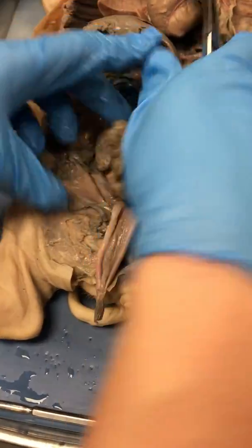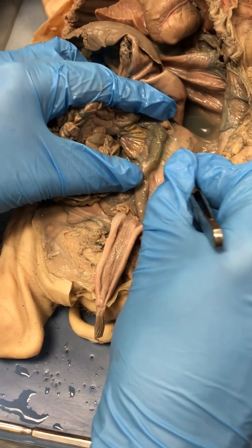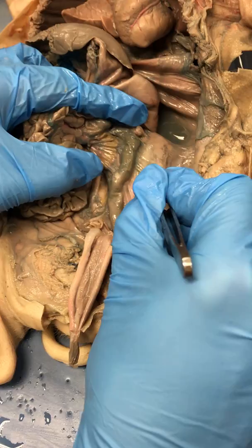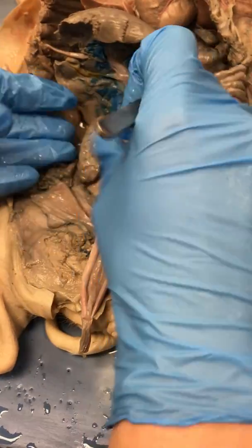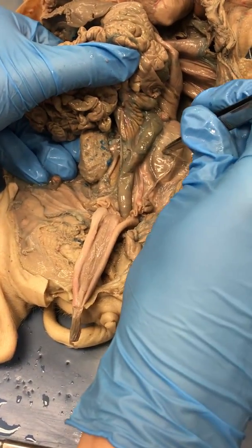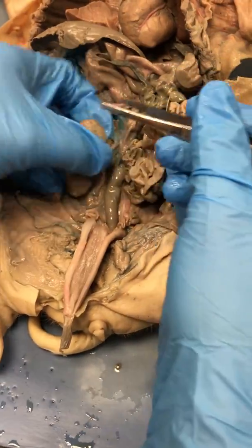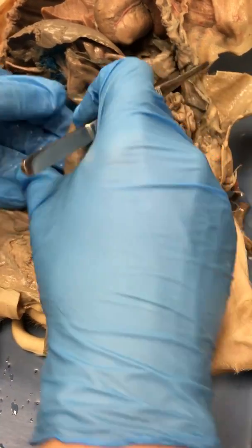to be able to see the urinary tract, you're going to have to break down this membrane right here. What is the membrane that encased the abdominal organs called? Peritoneum. Good job, guys. Okay, so you've got to break that down. Once you've broken that down, you see you've got a set of paired organs right here. These organs are what filter blood and produce urine. Those are our what, guys? Kidneys. Good.